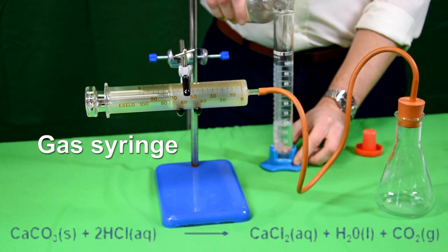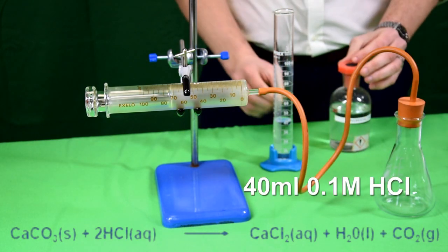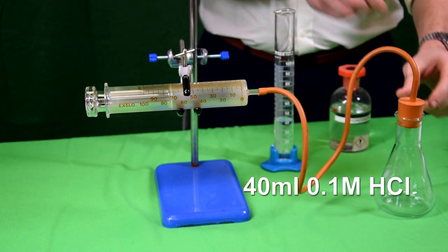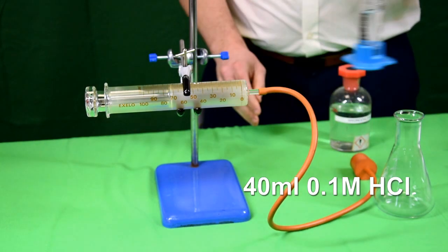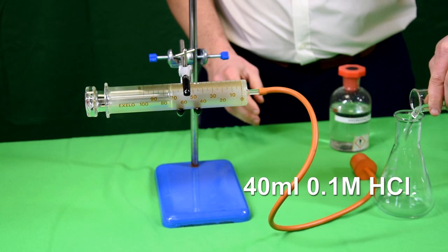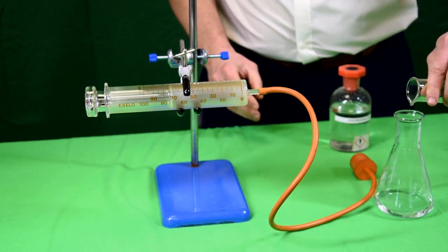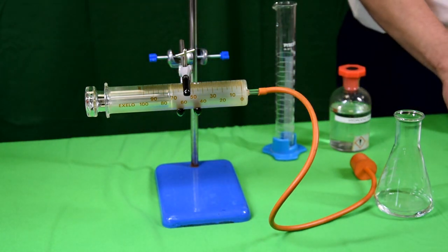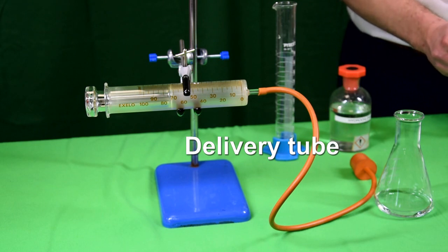We're going to follow the rate of reaction by measuring the amount of CO₂ produced using a gas syringe. The acid is poured into a conical flask and the gas will be collected using a delivery tube and a gas syringe.